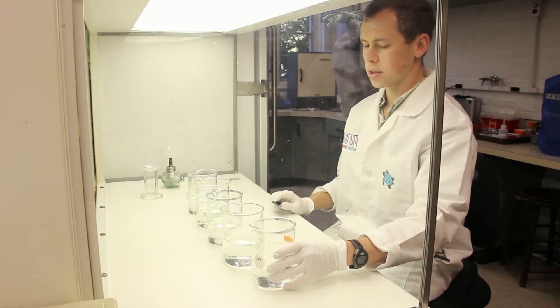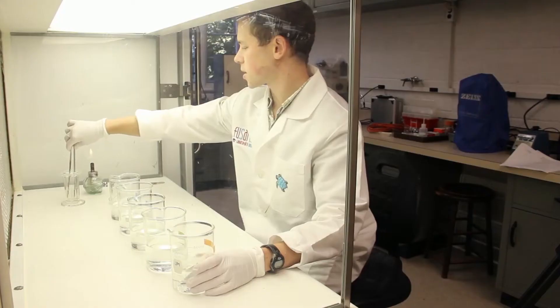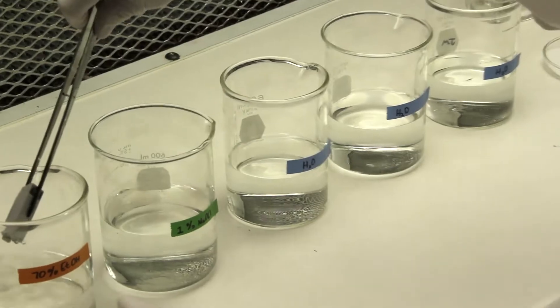In order to surface sterilize the seed, first we put infected seed into microcassettes. We then run that microcassette underwater for a few minutes and then we go through the sterilization process where we rinse the microcassette in 70% ethanol, then in 1% sodium hypochlorite.